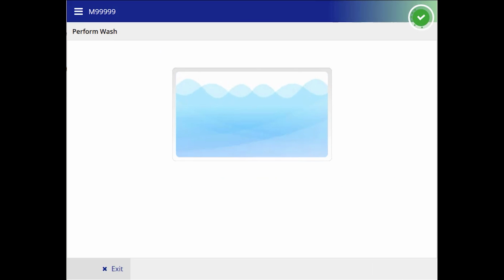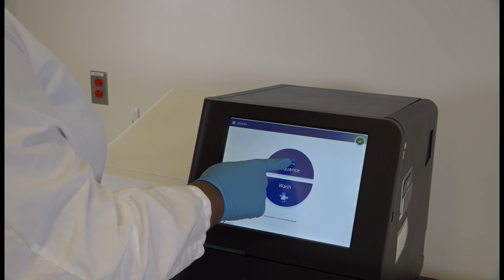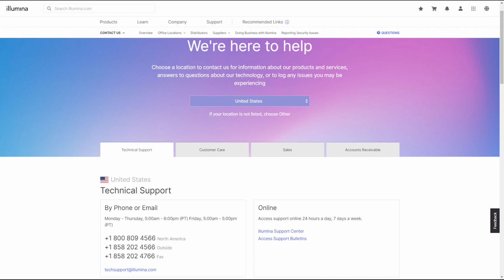Once the wash is completed, load the reagent cartridge, flow cell, and buffer from the previous run and proceed with starting a new run. Please contact Illumina Tech Support if the issue is not resolved or further assistance is needed.